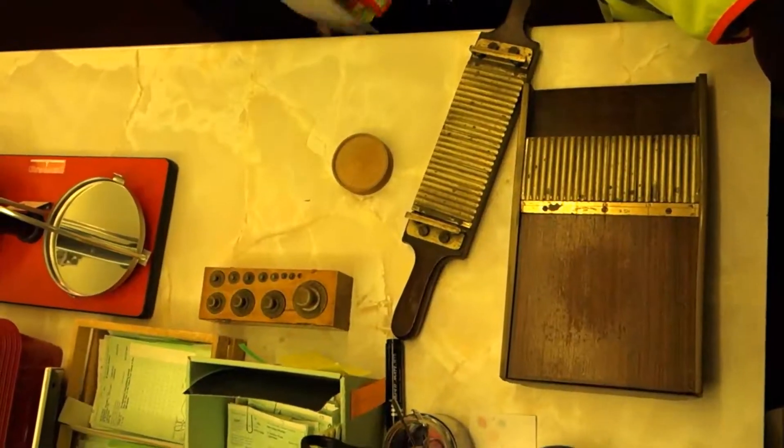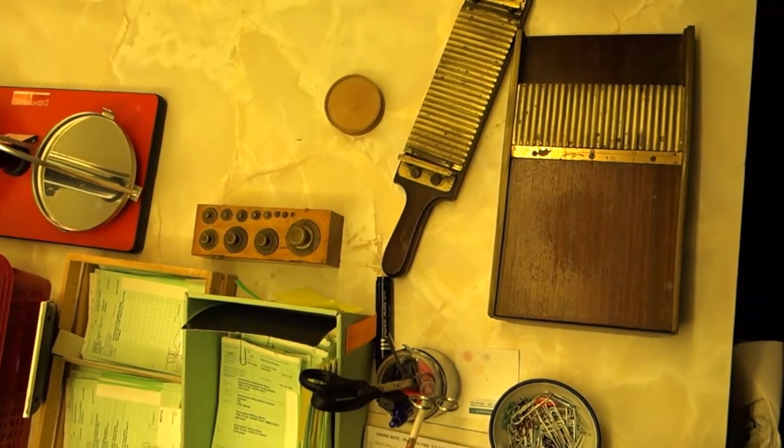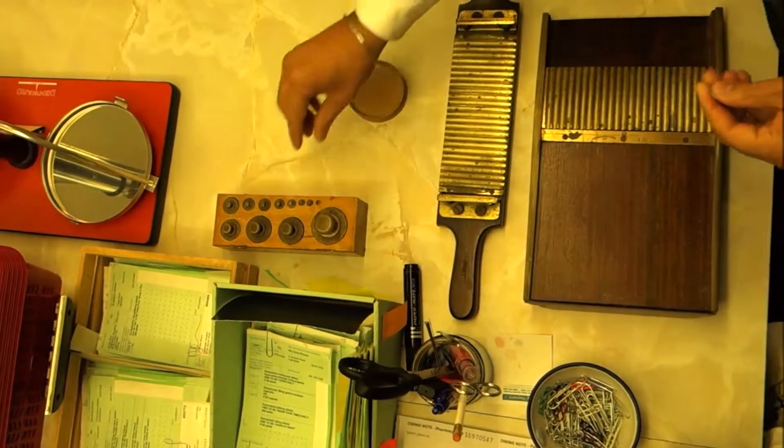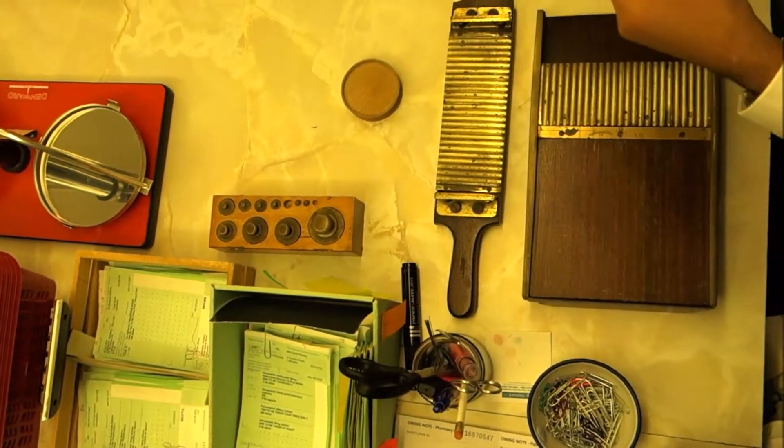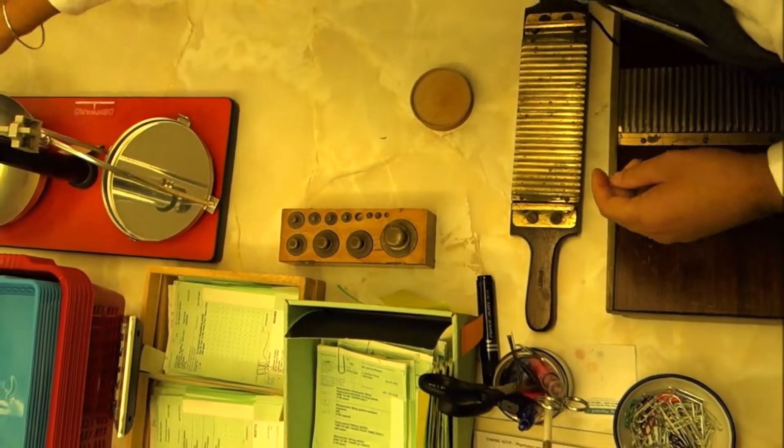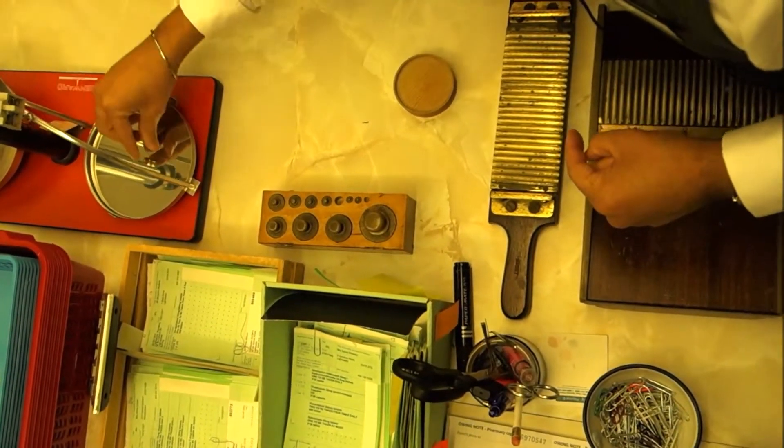I used to do as pharmacists. If you want to turn around this way, what the pharmacist would do is take a weight, put it on here, and then measure ingredients onto one side. This will show them how much is needed.